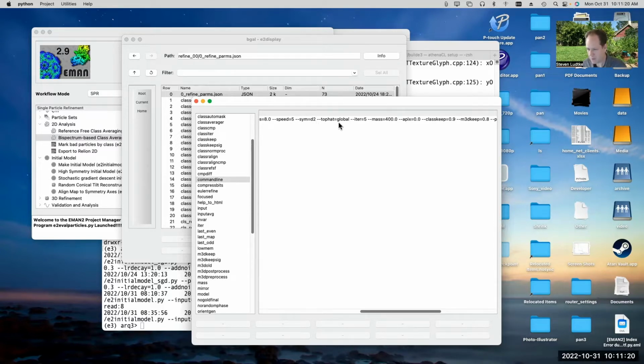Symmetry D2, this top hat option, that's explained in the tutorial in detail, but that's the reason why the map looks kind of noisy, because I used top hat equals global. It sharpens things and doesn't do anything to low pass filter the noise in places where it's bad. Top hat equals local would have produced a nicer, smoother looking structure with less noise outside. It takes a little longer to run.